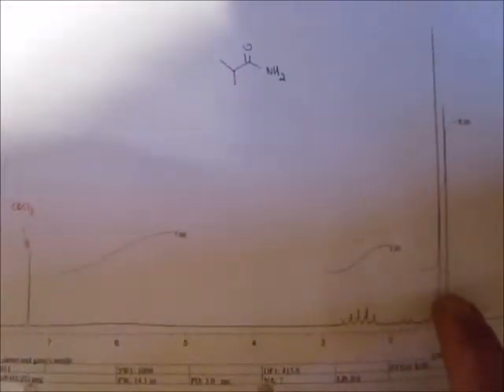Then we move on to the amide. So the old compound that we made was with the methyl group there. You're going to see a doublet, a septet, and you're going to see, this was chloroform D, but there's a very wide baseline right there, and it does integrate to almost 2. Those are both of the H's on the nitrogen, very broad one.